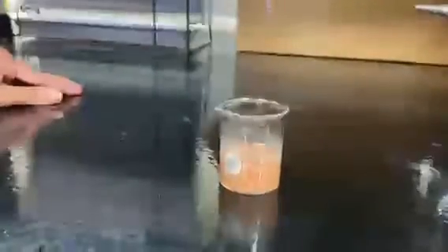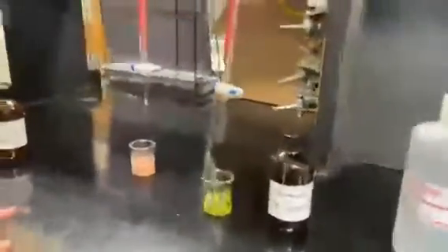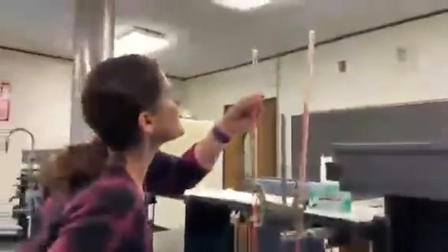Okay. All right, I have, okay, that red persisting here. And again, I look to my burette and I'm seeing around 6.1 mLs were added here. Okay. And last but certainly not least, my silver acetate and sodium acetate.